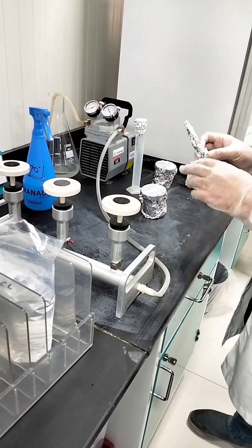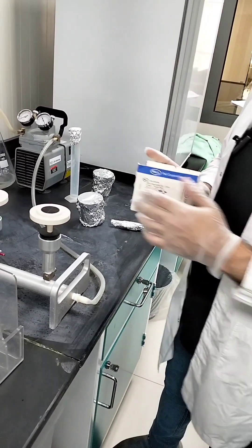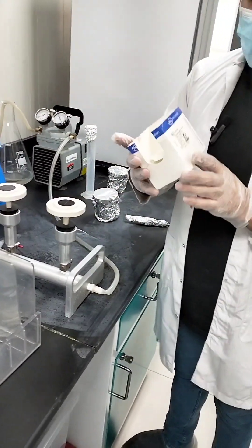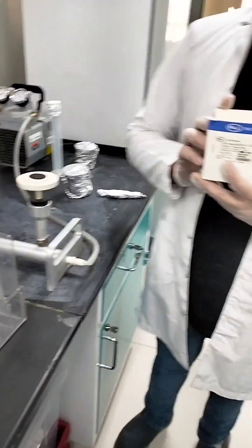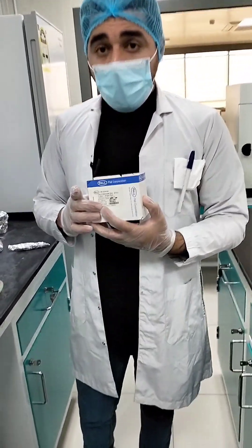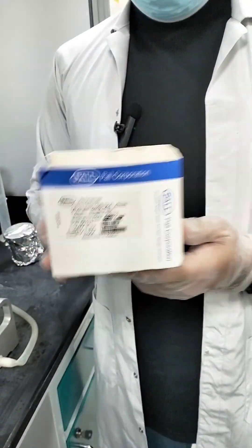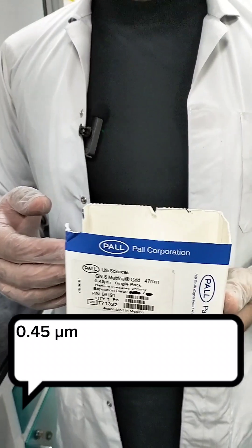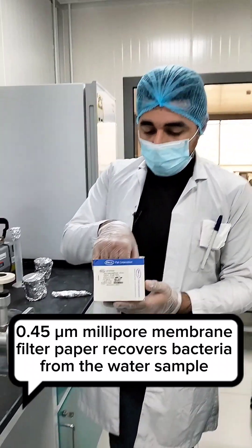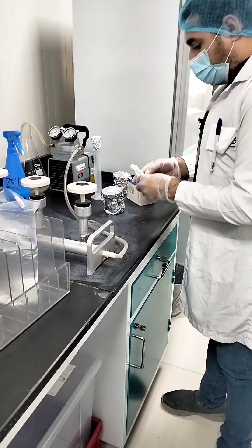Now I will place the membrane filter paper on the filter part of the membrane filtration assembly. This filter paper has a pore size of 0.45 micrometers. We use this size because it retains bacteria from the sample and does not allow bacteria to pass through it.